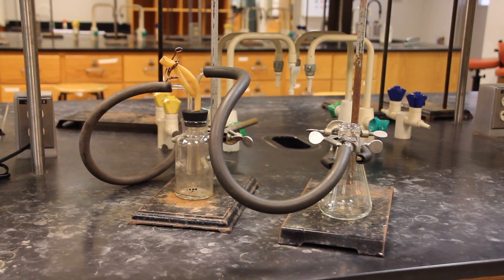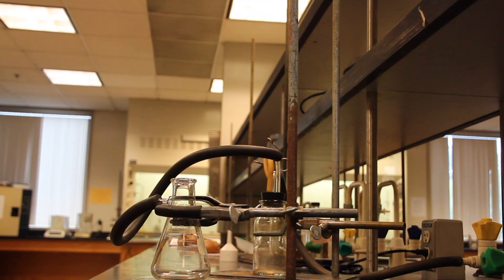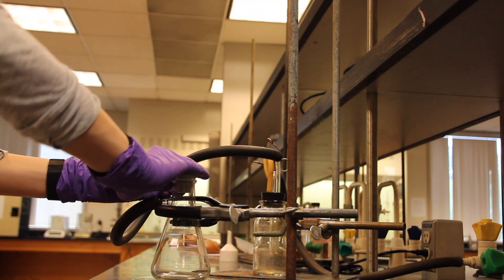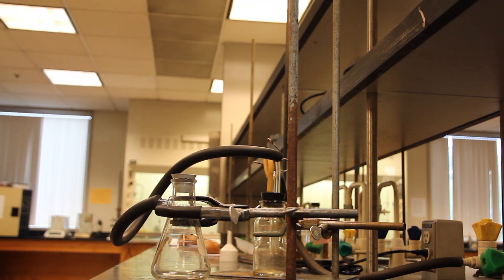Here is an overview of the setup so far. Before beginning recrystallization, we will add the neoprene adapter and Buechner funnel to the top of the filter flask.